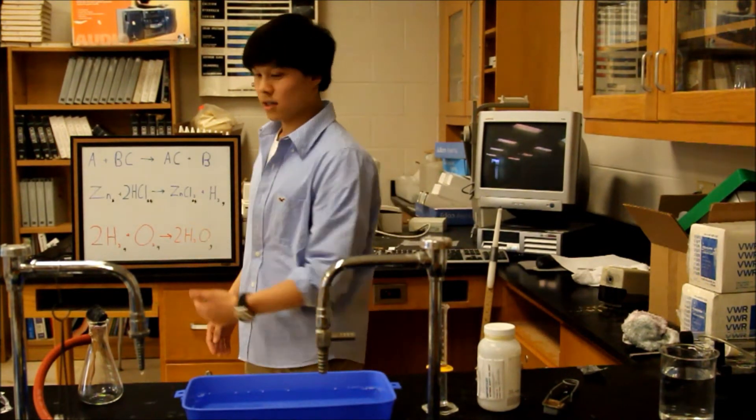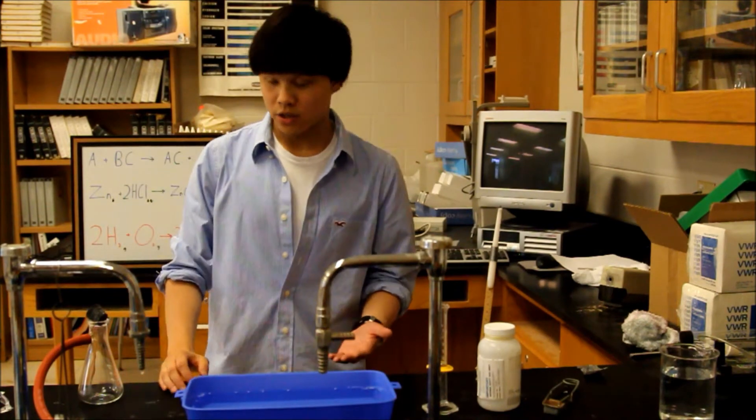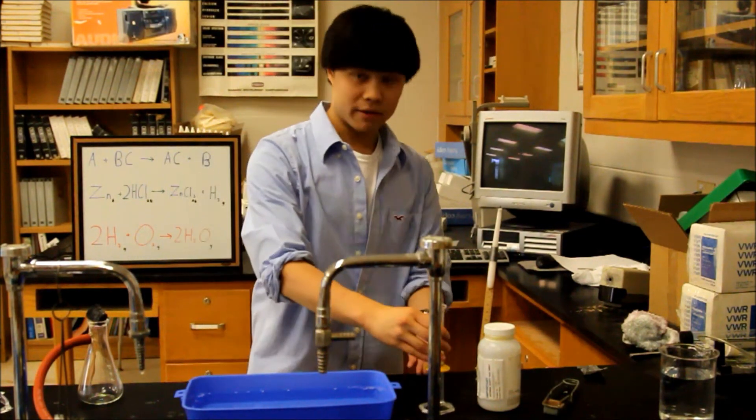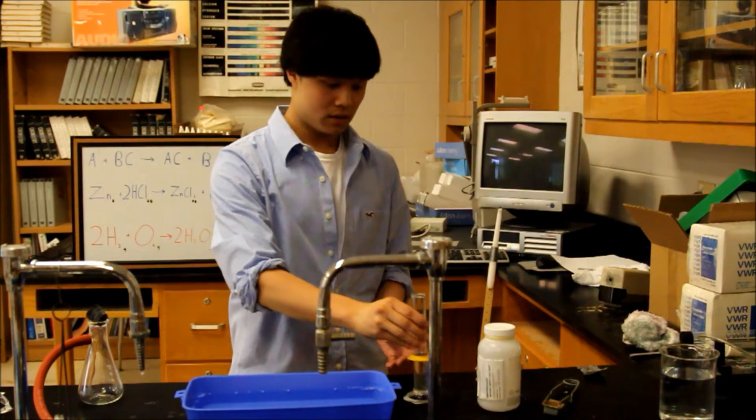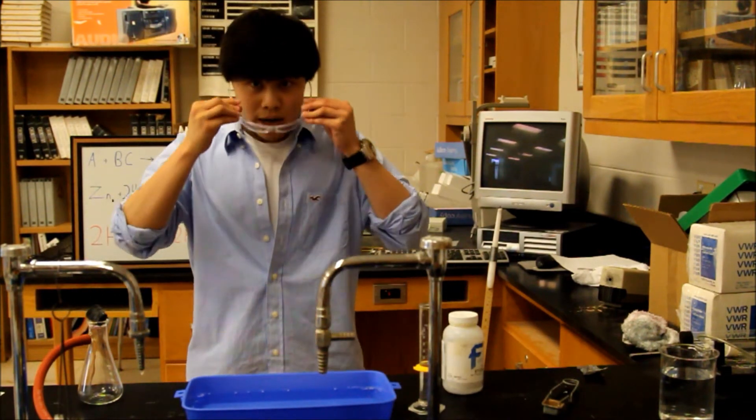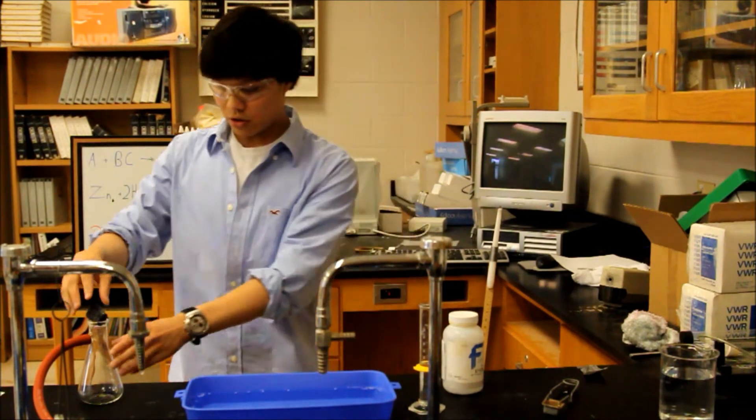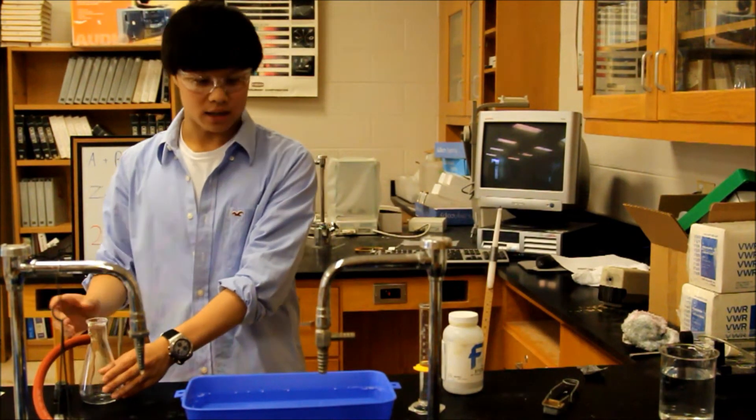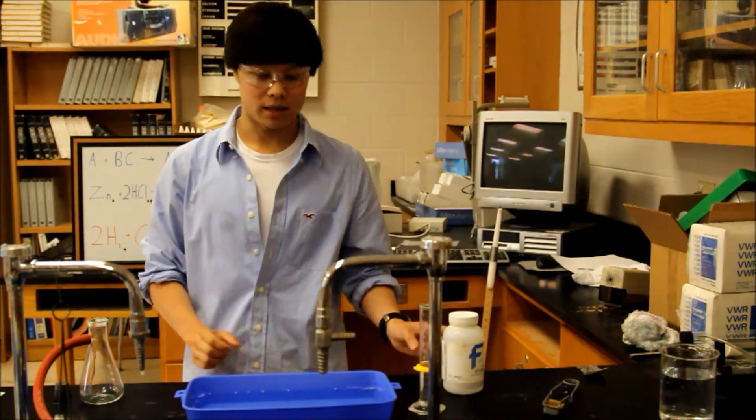The best way to see this is to actually do a real single replacement reaction. Over here we have 6 molar HCl as well as zinc metal. What I'm going to do is react these two in this flask and collect the gas in this gas collection tube.